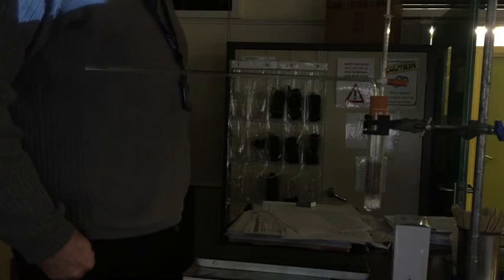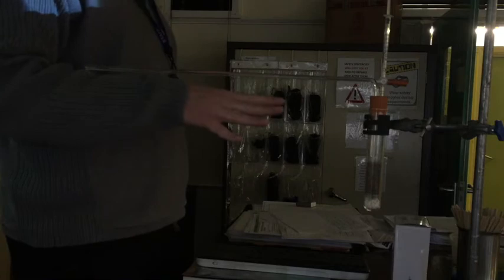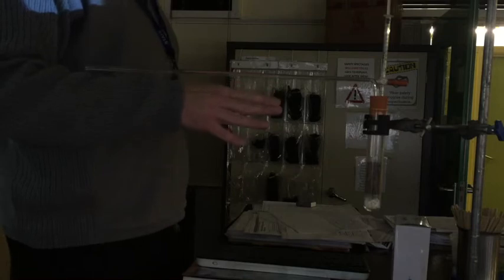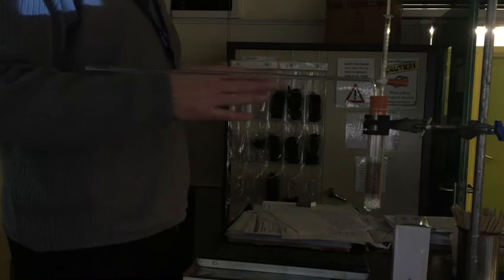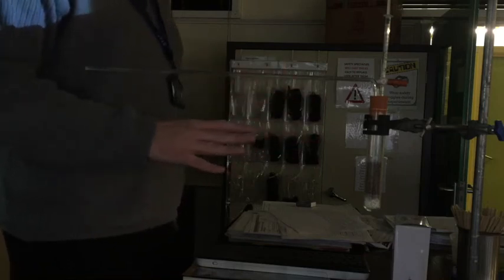The maggots are in this, are they alive? Yep, they're in there. Are they going to stay alive? Yep, they're going to stay alive. It's an ethical experiment. But maggots, we're okay. Schools are okay to experiment on any organism that does not have a complex nervous system, so that's basically insects and worms and things like that. Anything like even fish, you would need to apply for a home office permit with a full kind of massive booklet of different instructions to say what you do. Obviously schools don't do that, but that's what they do if they're doing animal testing. Even psychological studies require that for anything with a more complicated nervous system. So it's only maggots.